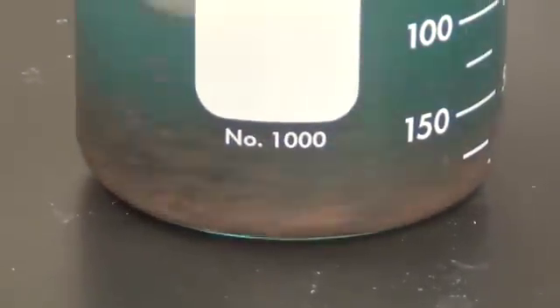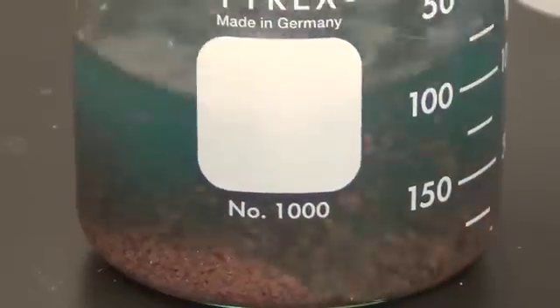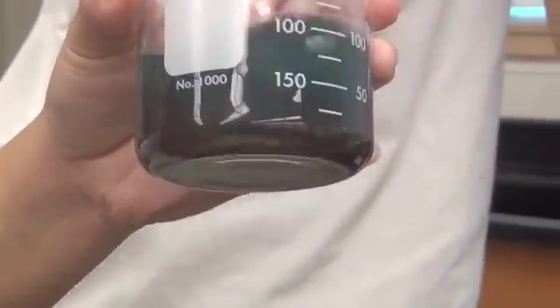It's a little warm. Yeah, it's warm. Wow, that's so cool — it actually worked! Who came up with this idea? We. I did. Go, Kristen! Yeah, I said put zinc in.